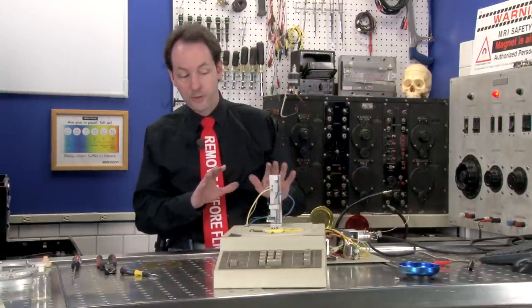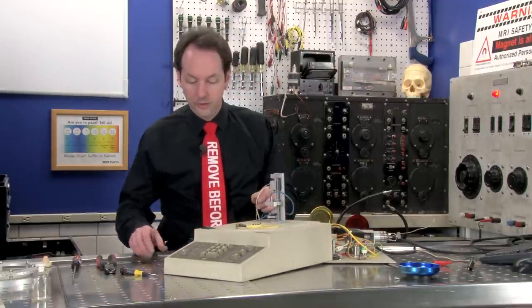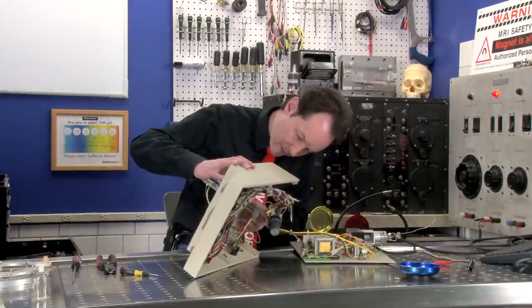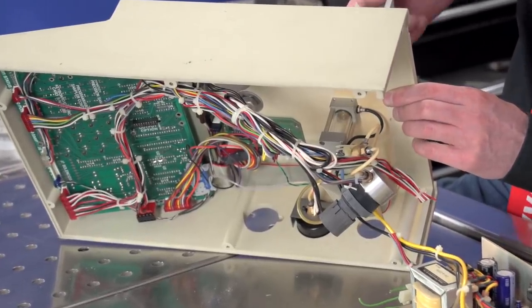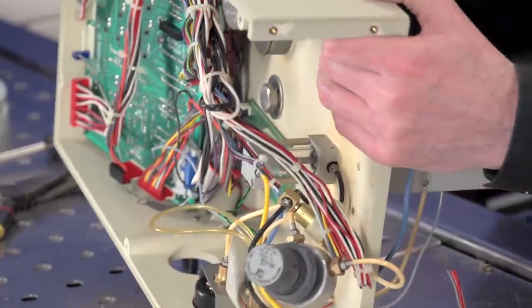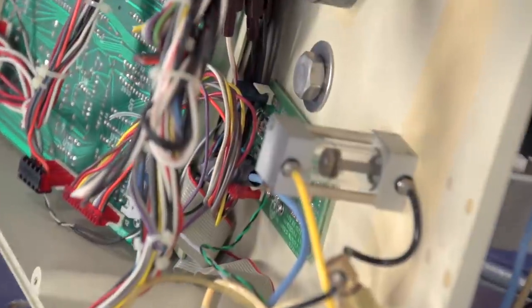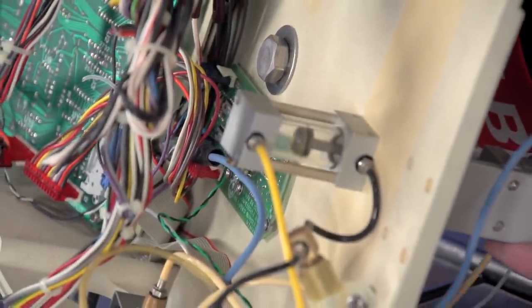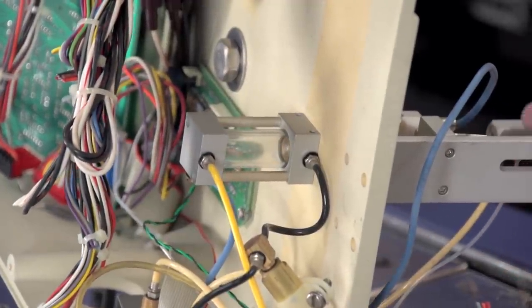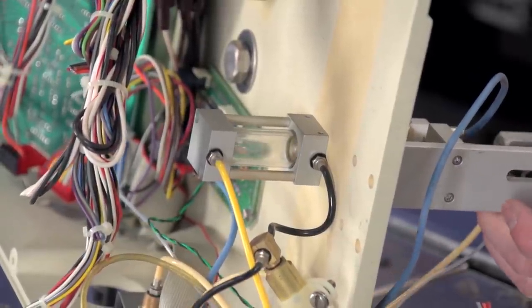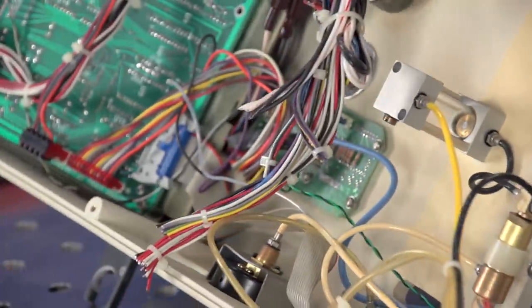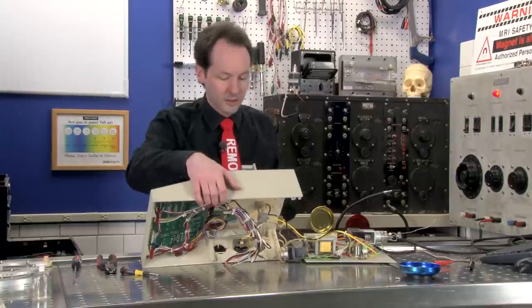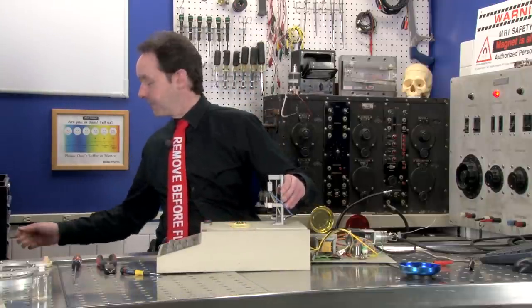This here is not a fluid reservoir as I first thought. It's actually a hydraulic or pneumatic cylinder. You can see the piston in there going up and down as I move this, which is kind of cool. Well, I only see one thing that could be the actual mount, and I might be able to get that up. I'm going to try.